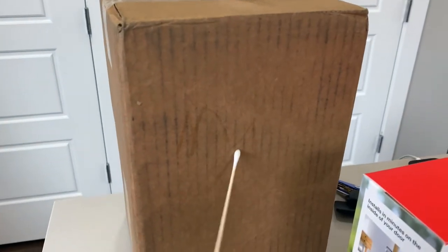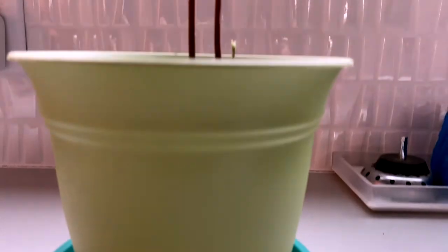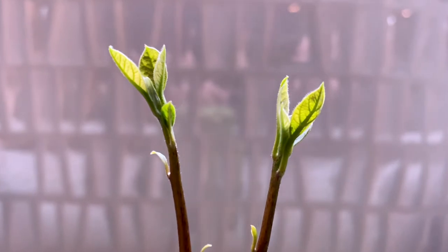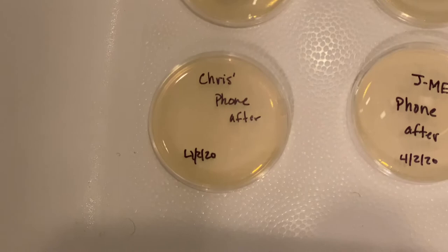Swabbing a package I had literally just brought up from outside to see how gross it is. And I asked my boyfriend what he wanted for the last one — he picked his toilet. I do not have footage of that. So here is my baby avocado plant. Now we have all of them done, swabbed and documented.